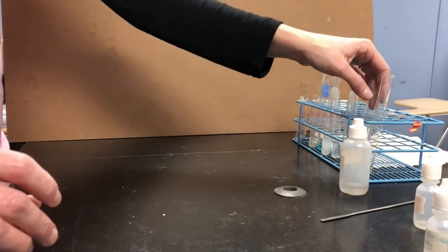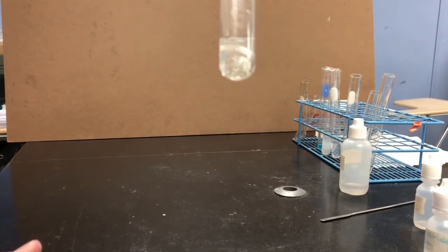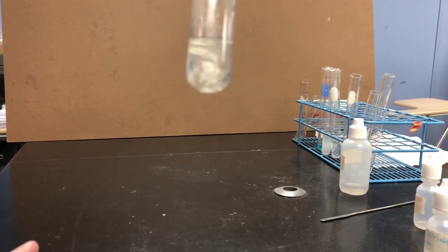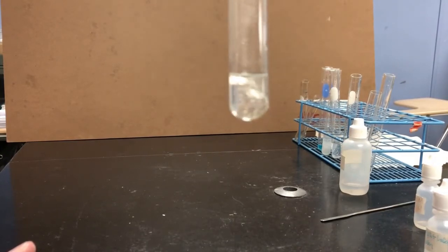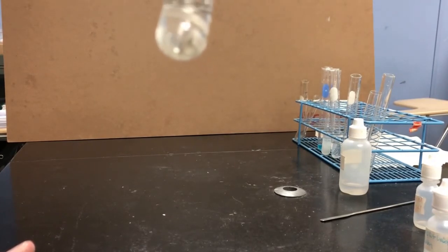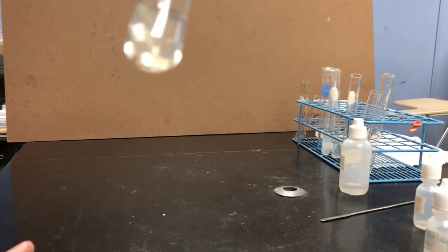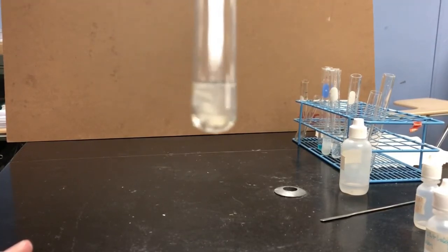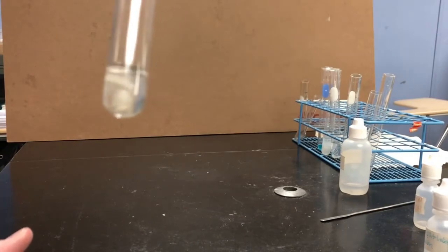Let's go back and look at other ones that we said we were going to check back in on. Reaction 3 here has finally died down. There are still a couple bubbles I can see there, but I can tell now that the liquid here is definitely not white. It's definitely clear and colorless like water. I still see some bubbles stuck to the side, but I can kind of shake those away. Looks like I've got some magnesium metal left over. It still looks like magnesium metal. It's silver, it's shiny. But obviously some sort of chemical reaction happened.